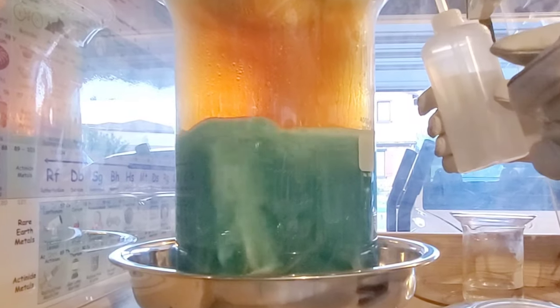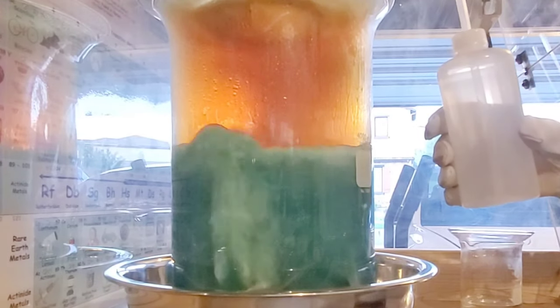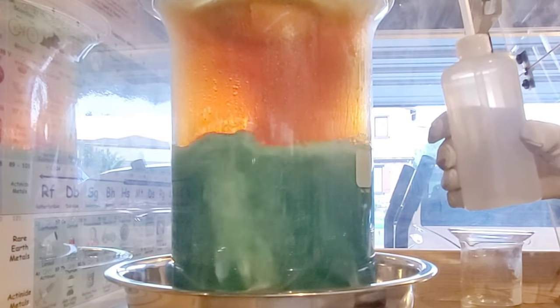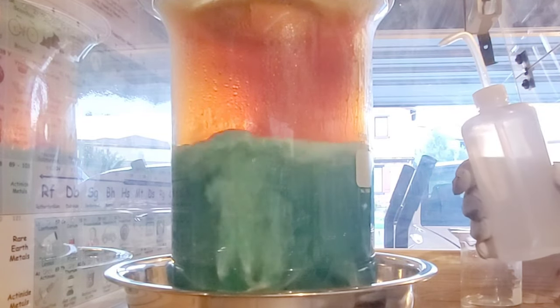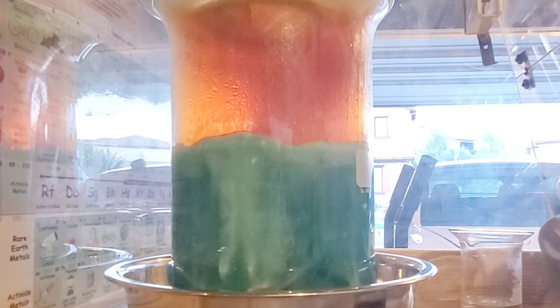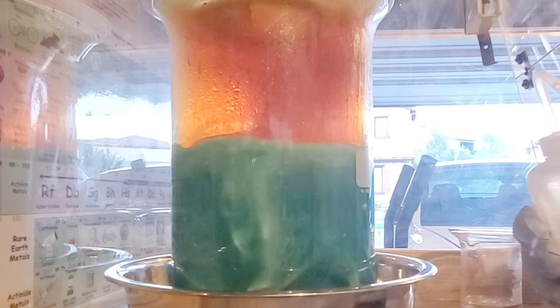If either too much sterling silver or nitric acid is added at once, the reaction can boil over. Here I'm just getting ready to add some distilled water if necessary, which will slow that reaction down.